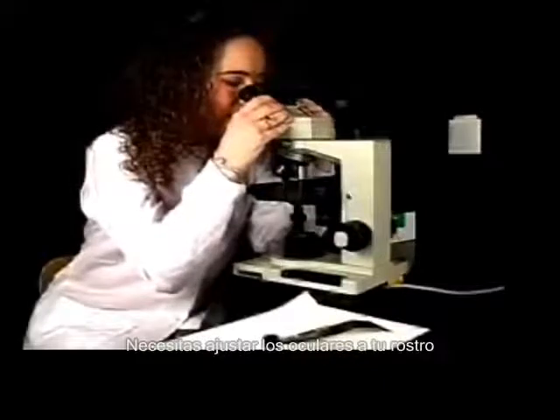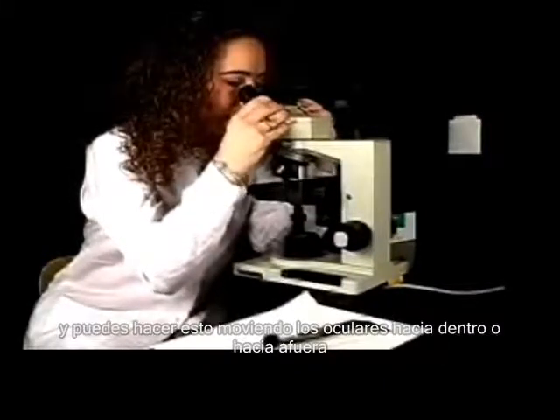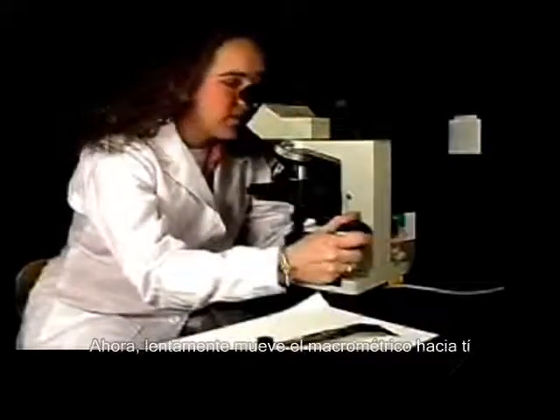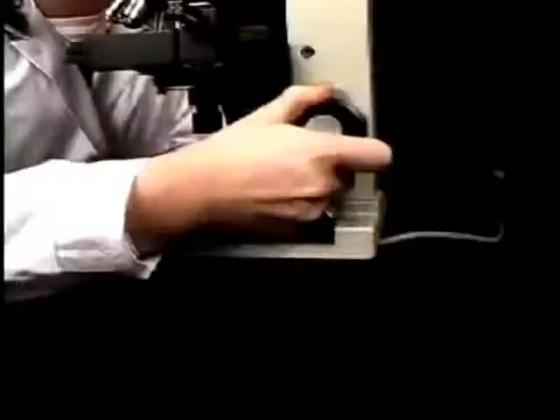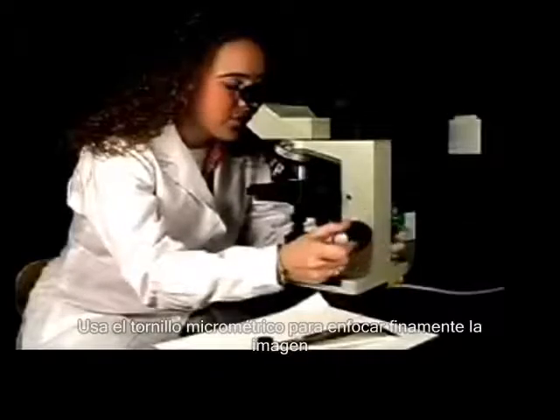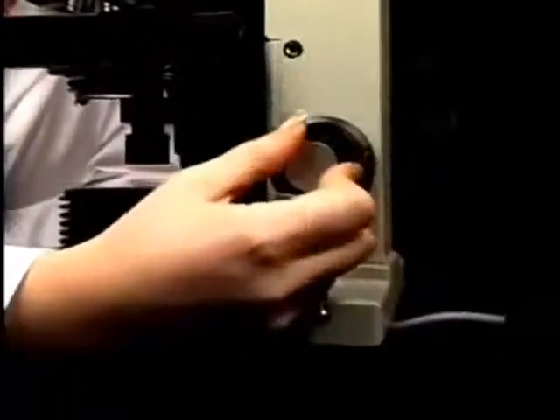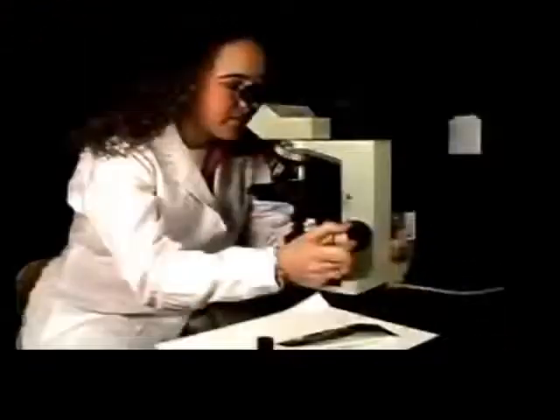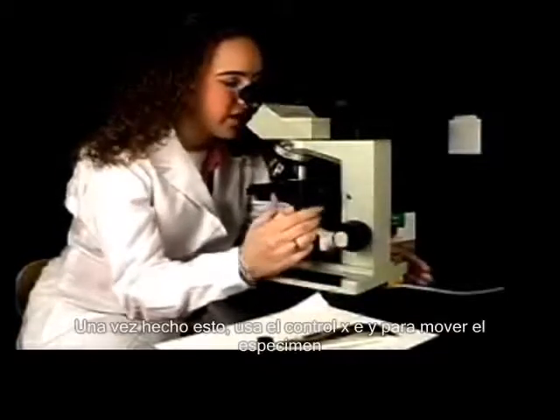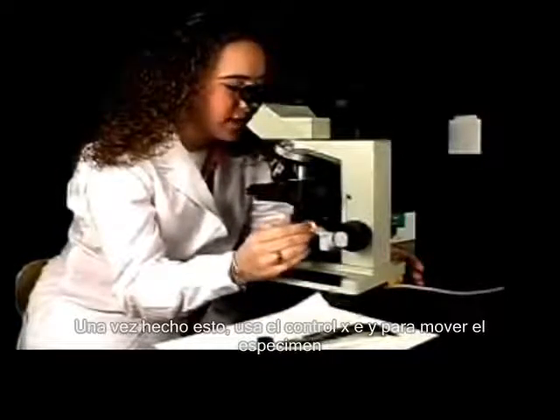You need to fit the oculars to your face, and you can do this by moving them in and out. Now, slowly move the coarse focus towards you until the specimen pops into view. You will also use your fine focus to sharpen the image. Once you have done this, you can use your XY controls to move the specimen around.